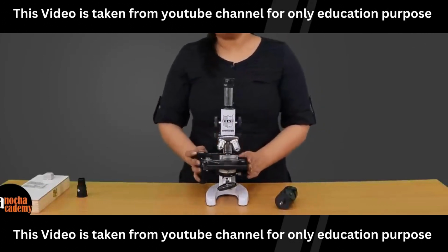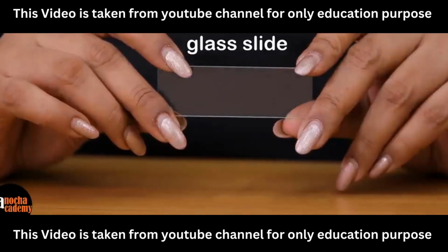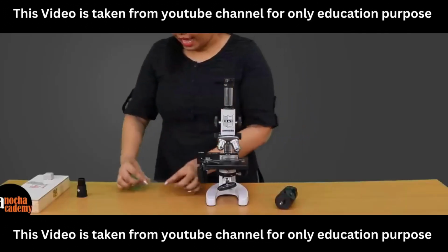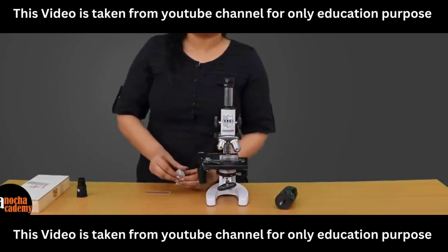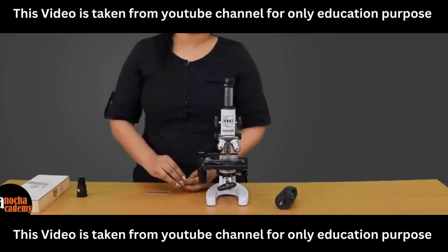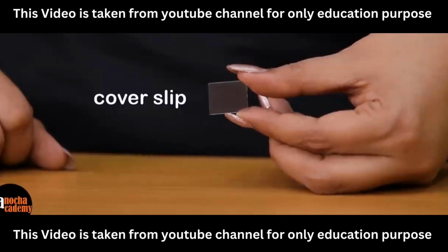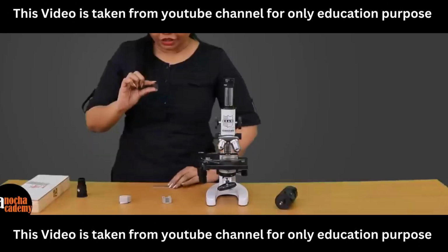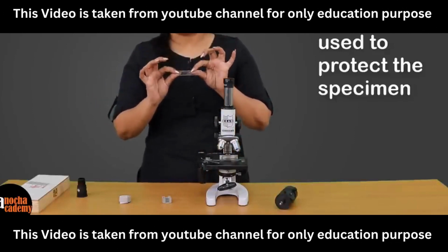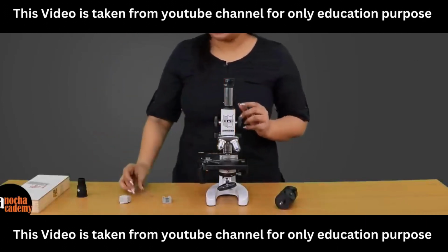Now we will show you a slide. This is a glass slide on which generally we put a specimen which we need to observe under the microscope, and so that your specimen does not fly away, does not dry out, and is not damaged, we usually cover the specimen with a cover slip. You can see this is an absolutely fine piece of glass which we use to cover and save the specimen from being damaged.